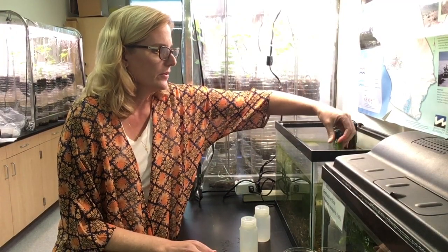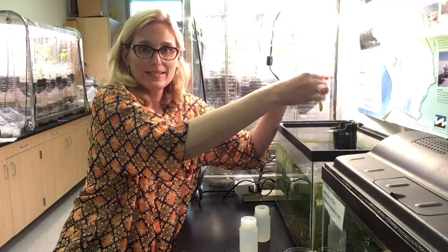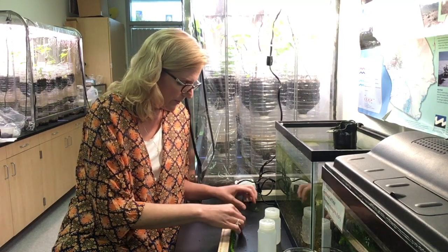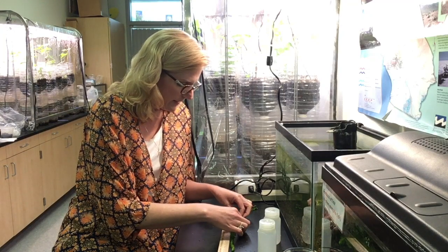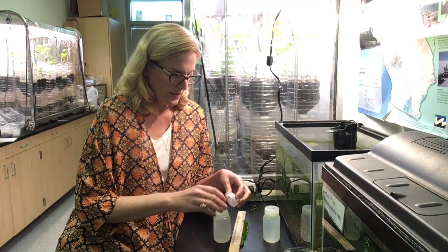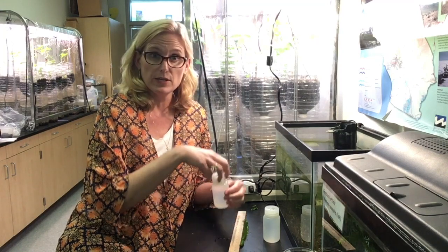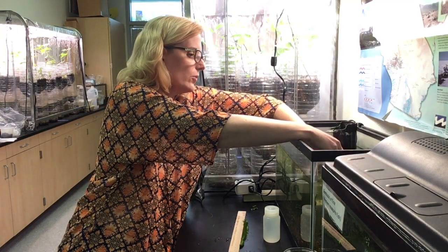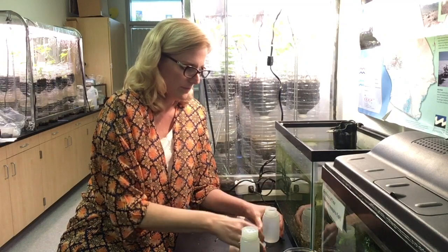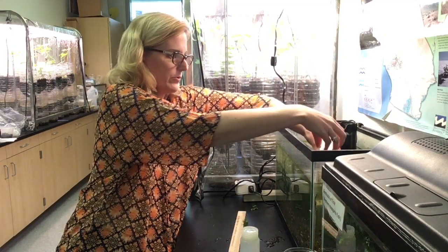Now I have my two completely filled bottles and I'm going to add some elodea. I'm going to take a water plant and add the same length to each bottle — I want almost equal sizes because I want that to be a constant. I'll use my ruler to measure pieces of elodea that are both exactly three centimeters in length and the same thickness, so I have almost identical pieces. I'll carefully put the elodea into the bottles and recap them underwater so all the air escapes and all I have is water and elodea.